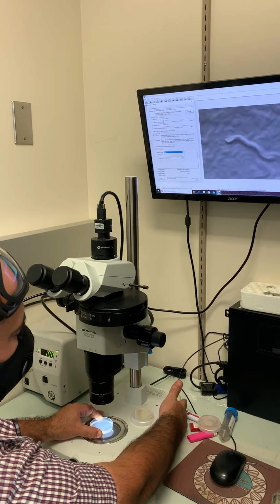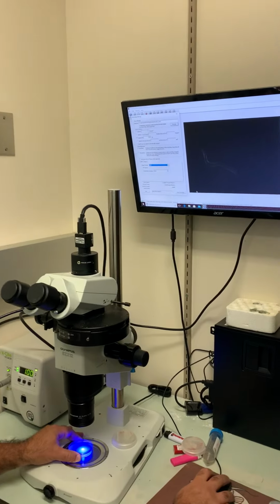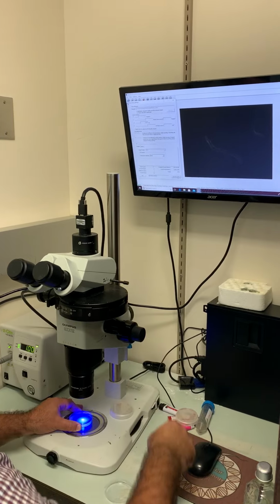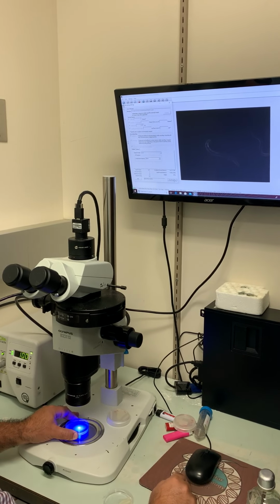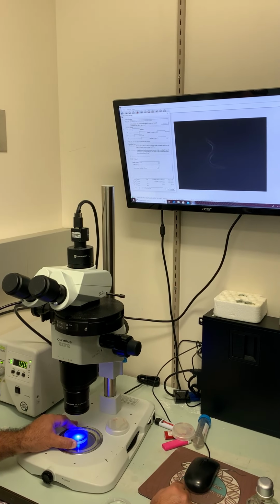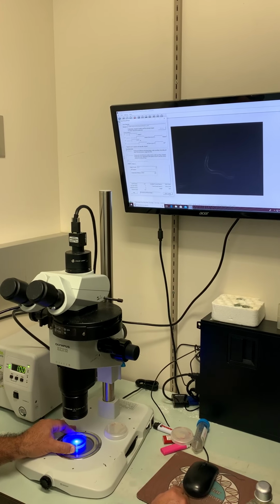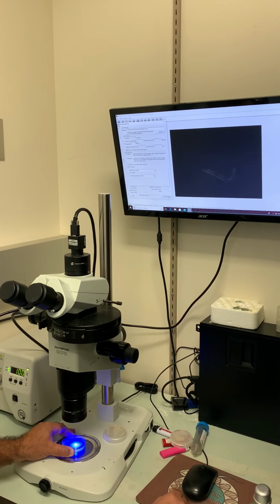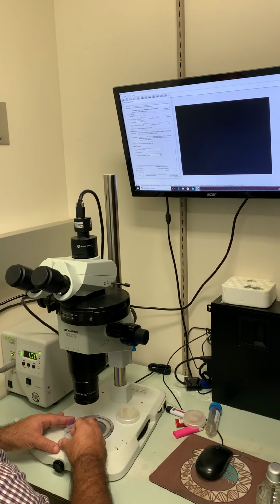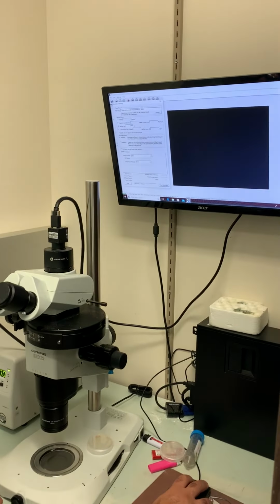But now I'm gonna turn this light off here, and I'm gonna press the shutter. And we start recording. And you might not see the worm in there, but it's right there in the middle. It's not really moving anywhere. When it reaches the 15, it already stopped, okay? So I'm gonna close this thing again. Turn the shutter off. And now those files are in this folder.